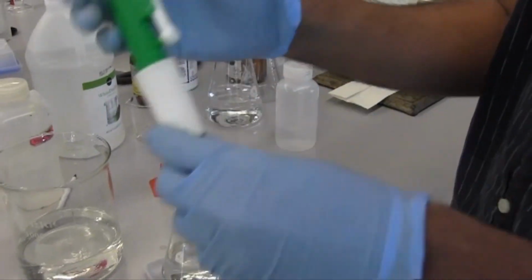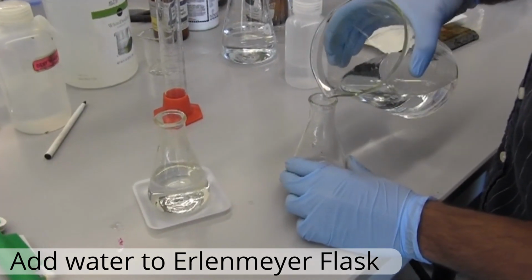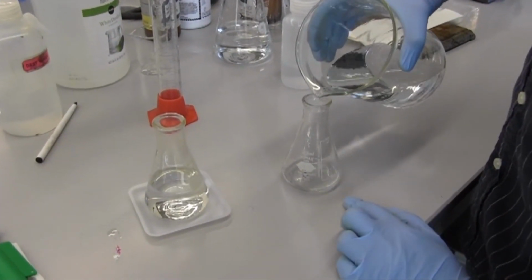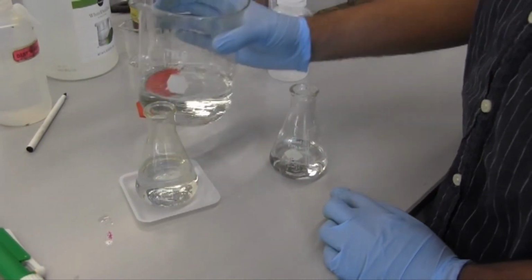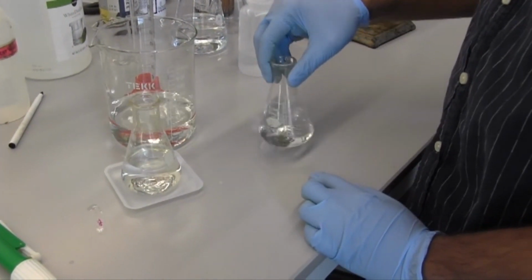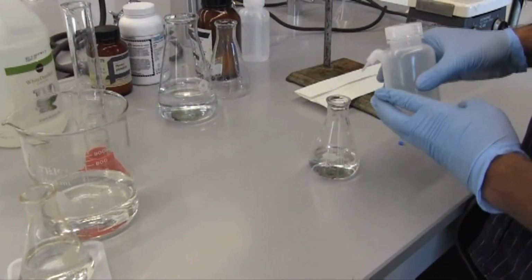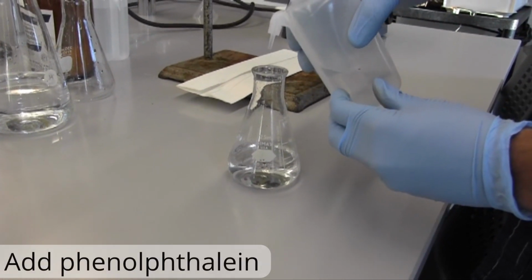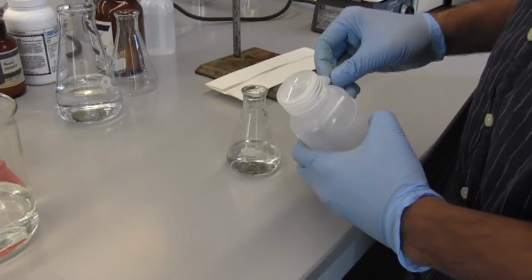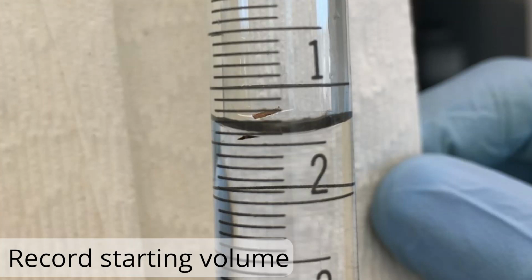Okay, so this Erlenmeyer flask now has 10 milliliters of our 10 times diluted solution, and to that, we'll just add some more water till we reach about 70 or so milliliters. Now, once again, what's important is not the amount of water, but the moles of acid, which is vinegar in our case. We'll add our phenolphthalein, our indicator, to make sure we'll know when the solution becomes neutral. And we'll go ahead and record our starting volume. So go ahead and write that down in your notebooks.